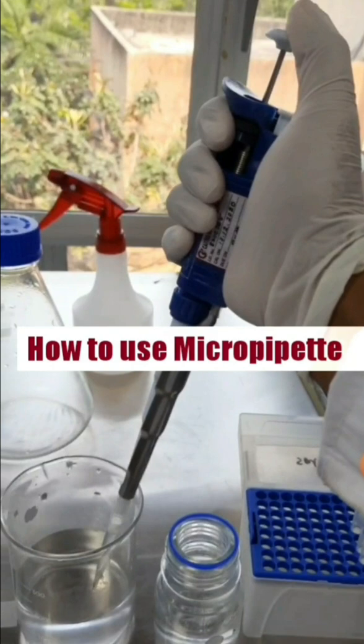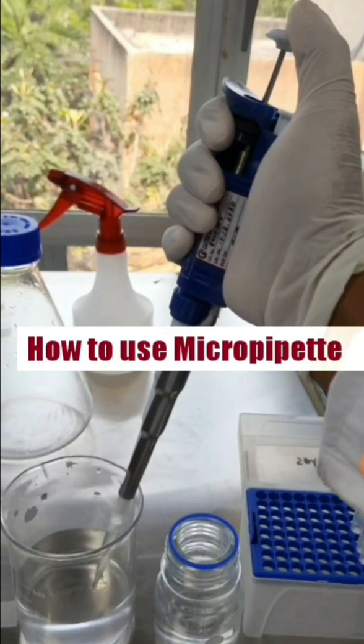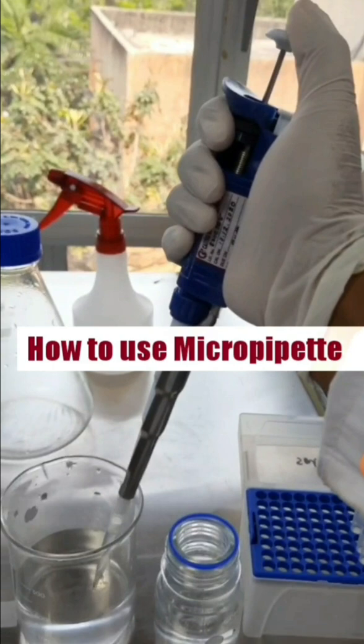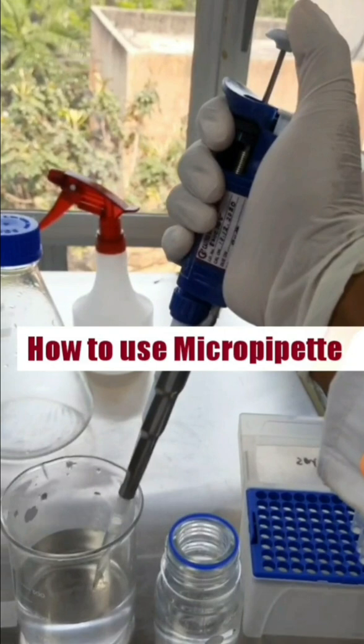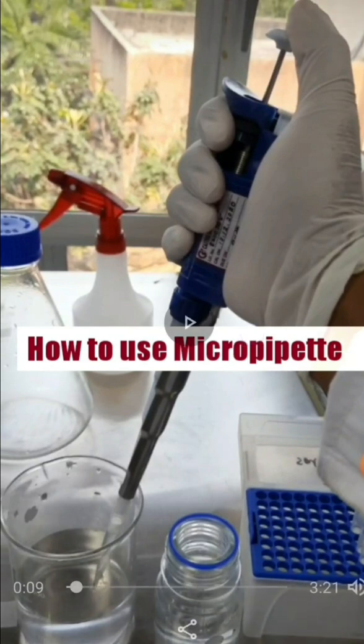Before discussing today's modern micropipette, we should first know something about the first invented pipettes and micropipettes. Let's discuss a little bit about the first invented micropipette.